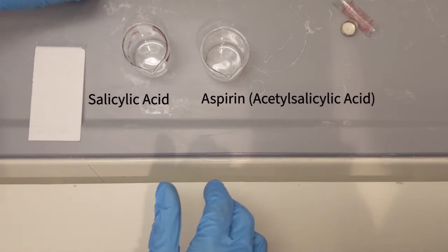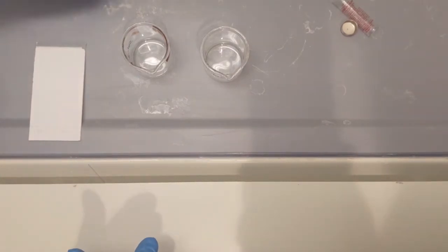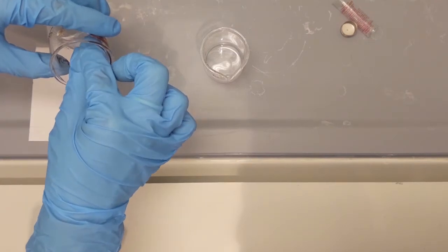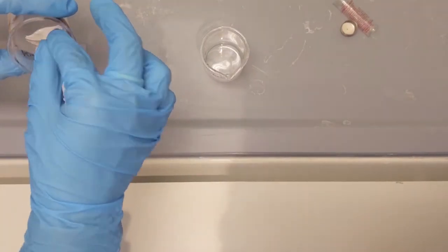You may want to spot your compounds on your marks more than once if your solution is too dilute.